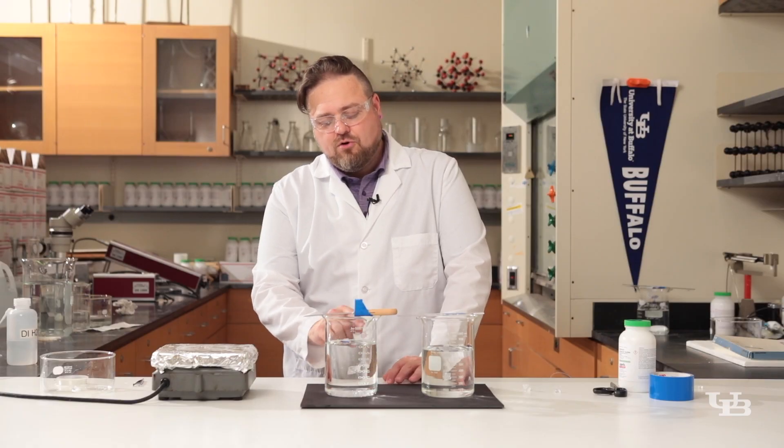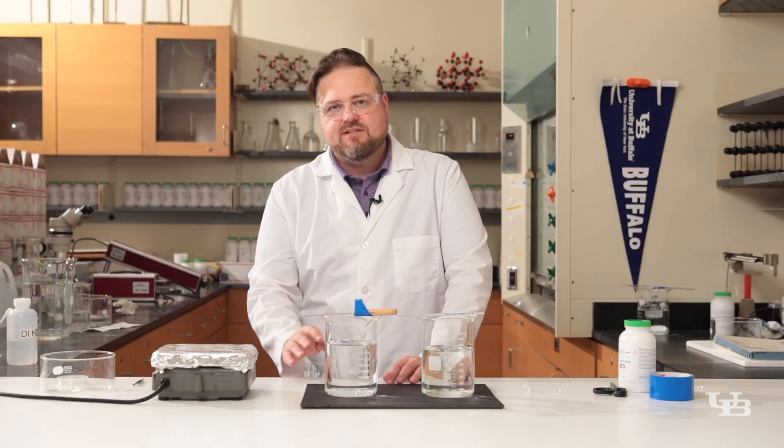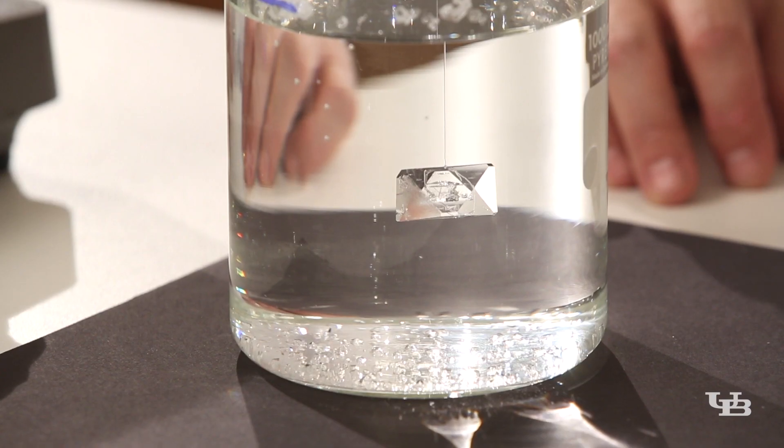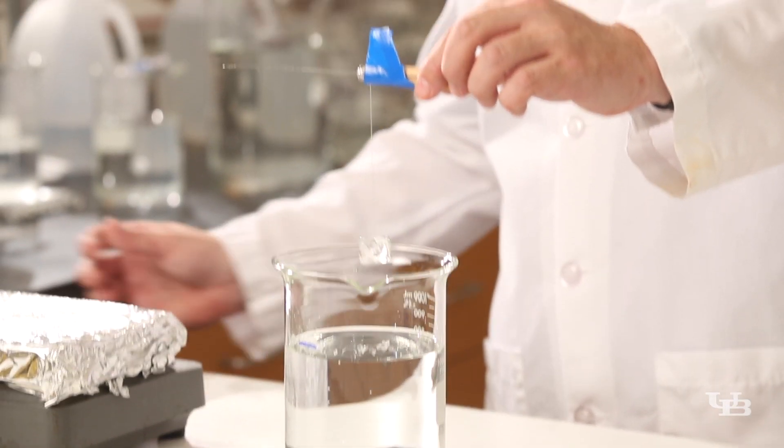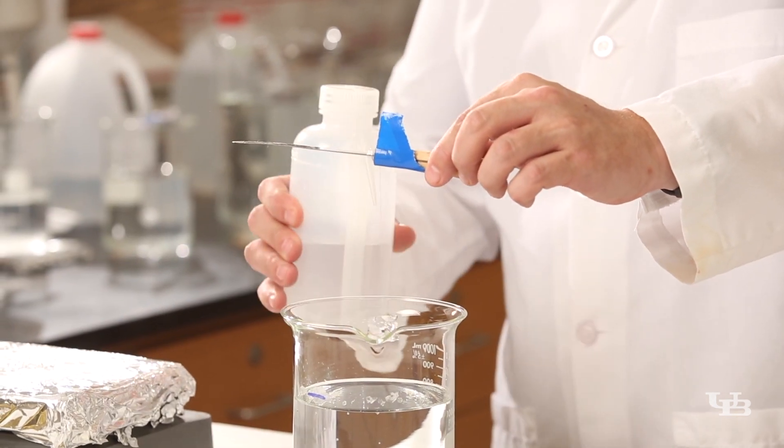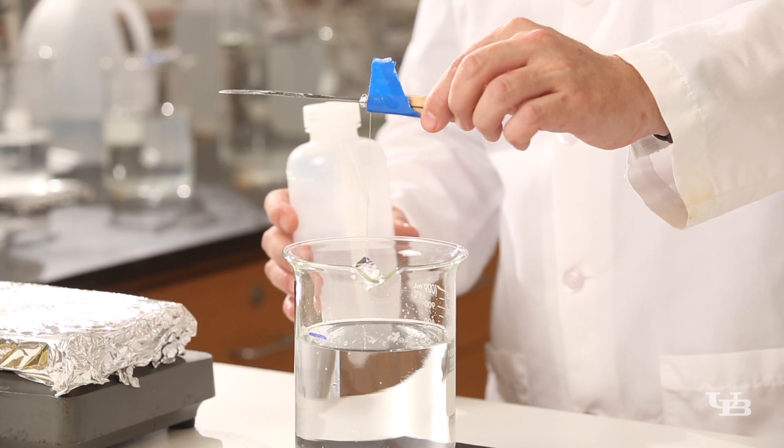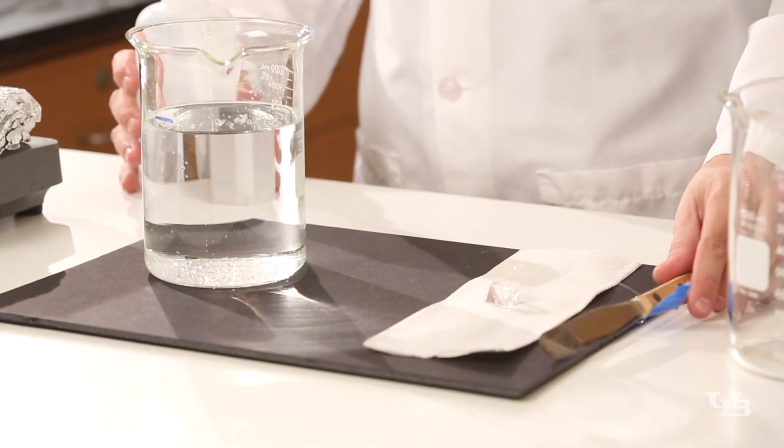How do we get rid of these parasitic little crystals? We're going to pull our crystal out of solution, reheat the solution, let it cool, and then put our crystal back in. The first step is to pull the crystal out of solution. You're going to want to squirt this off to prevent any possible little crusties from forming on the surface of the crystal and we'll set this to the side.